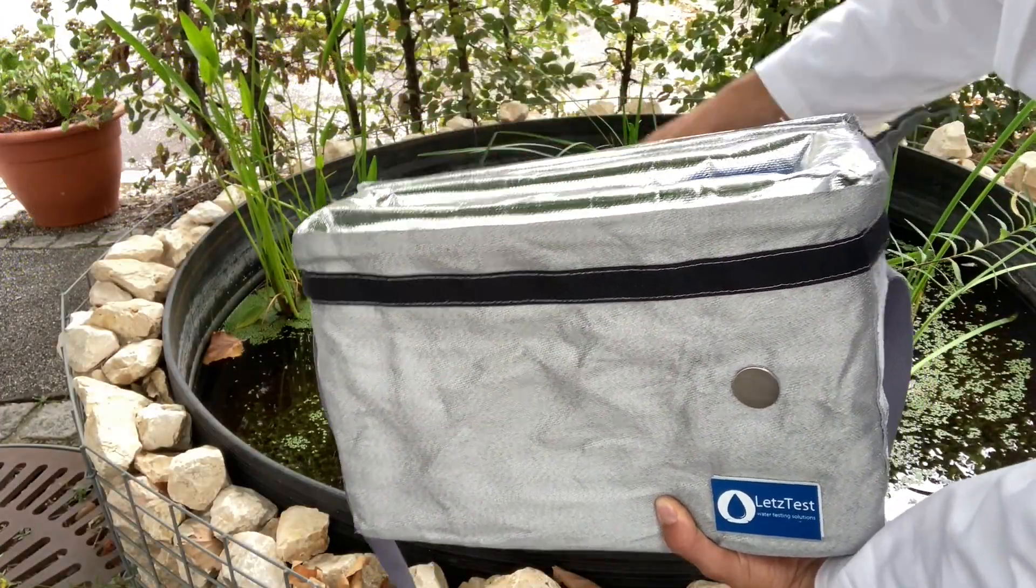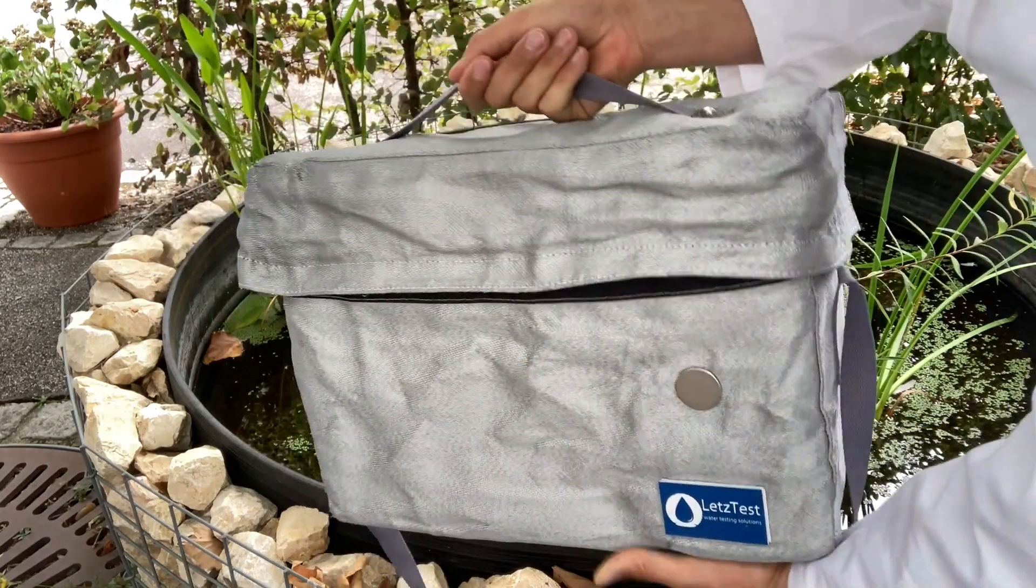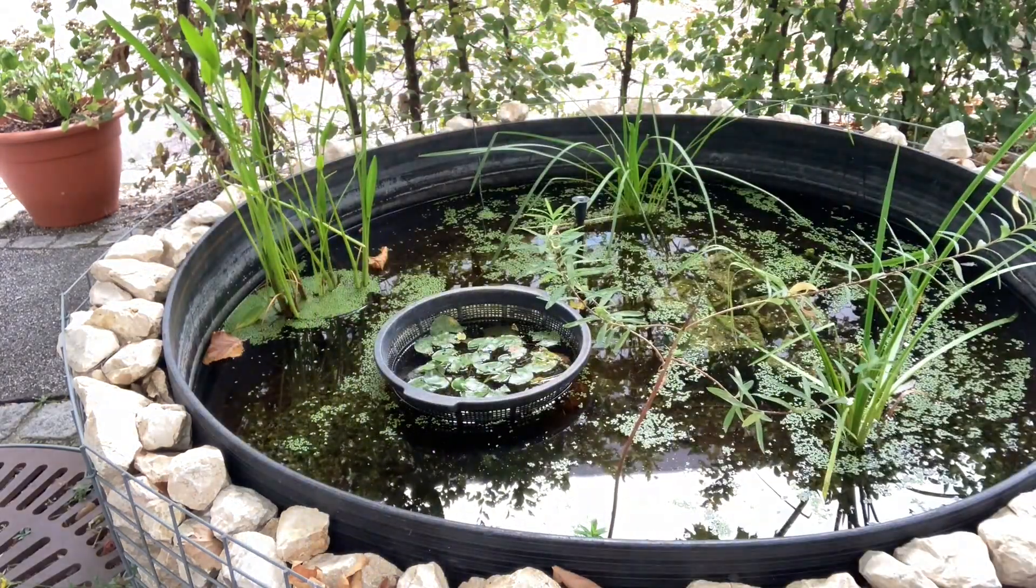Now transport the samples to a central testing location. Keep them cool and test them within 18 hours.